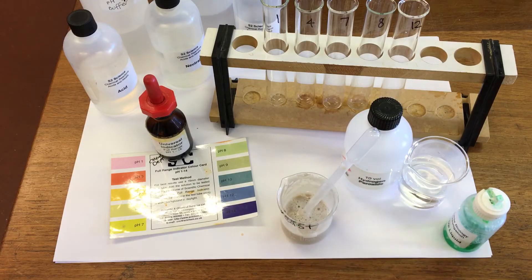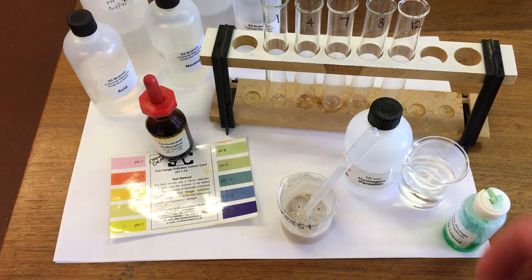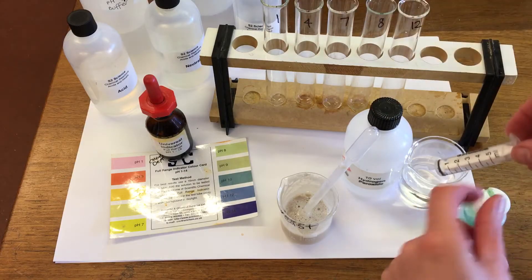So first of all, I'm going to put 5 ml of hydrogen peroxide into each of our tubes.